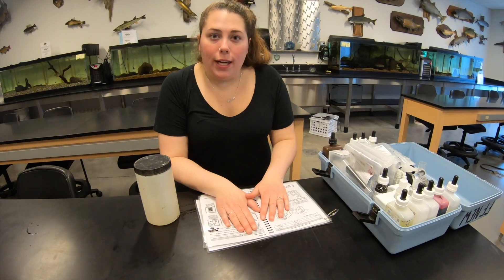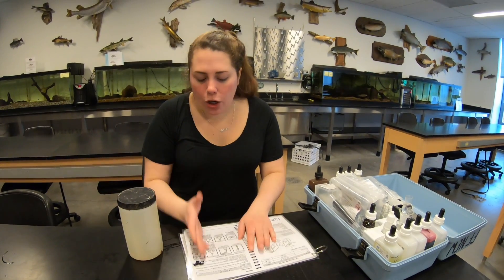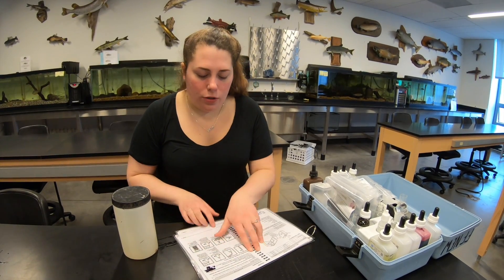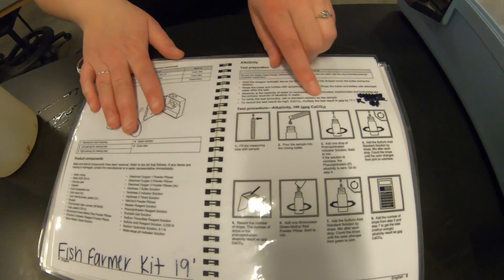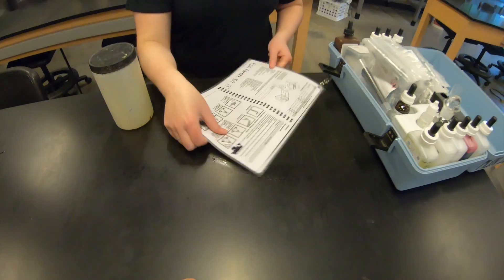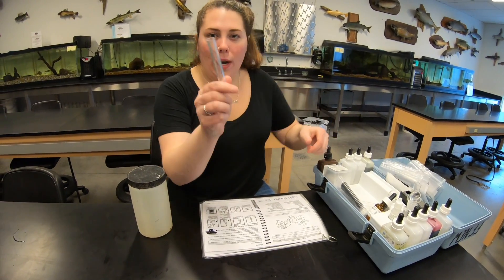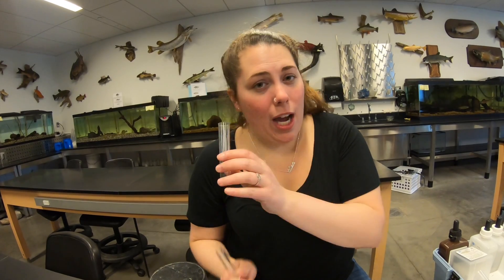First we're going to do alkalinity. We always do alkalinity high range first because if it's actually low range you may not be able to see that right away, so it's good practice to start high. This is pretty much just cookbook chemistry - the directions tell you everything you need to do. Make sure you read them carefully, as there are things we need to multiply by. Understand what the measuring tube and the viewing tube are - the viewing tube is for ammonia, not to be confused with the measuring tube, which everyone forgets on the exam.